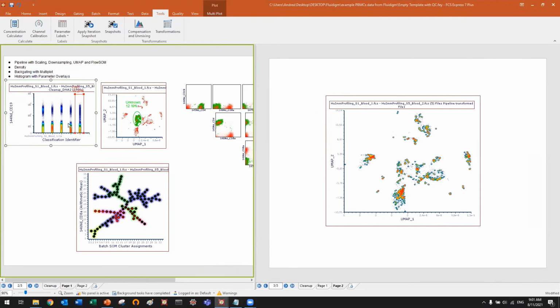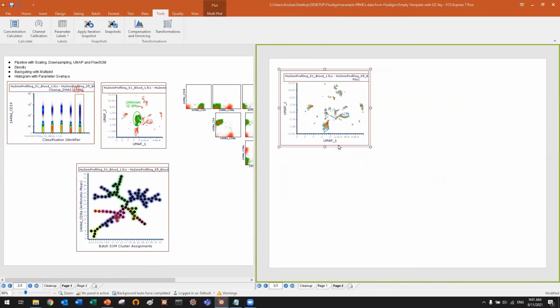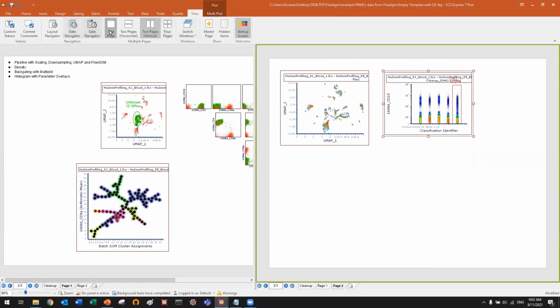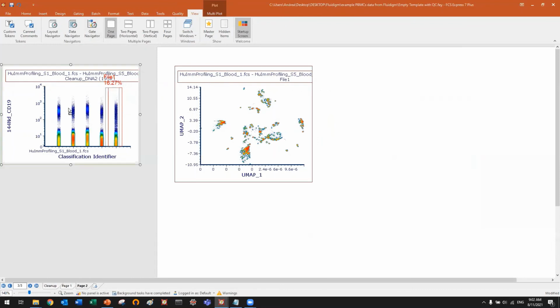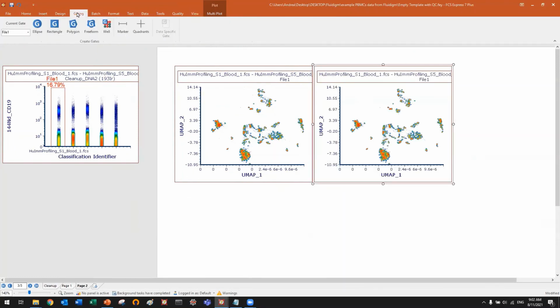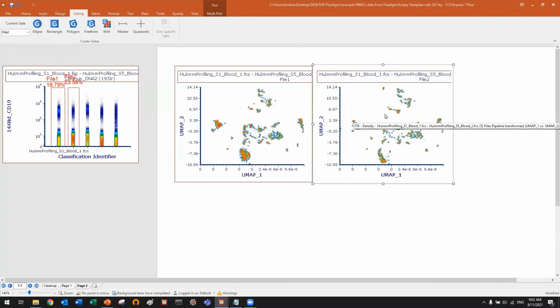Yeah, so it's basic. As I mentioned, usually you concatenate files, right? So in your merged file, you will have control, treated, like day 0, day 1, day 2, whatever. So I can, for example, display file number 1 on this UMAP. Okay, let's do it on one page so it will be easy to follow. View one page. Okay, so these are my 5 different files, and in this case I'm displaying UMAP for file number 1. I can have a second UMAP plot, and I can create a second gate here, and I call this file number 2.